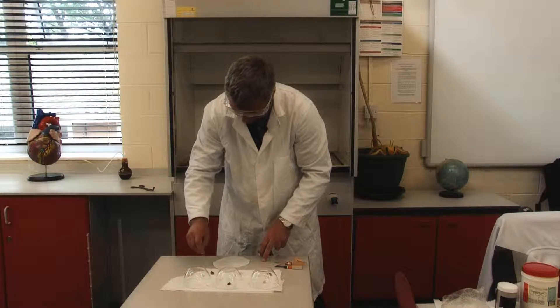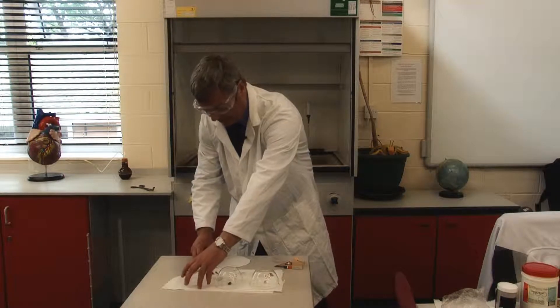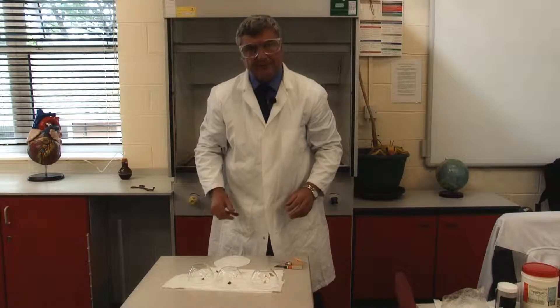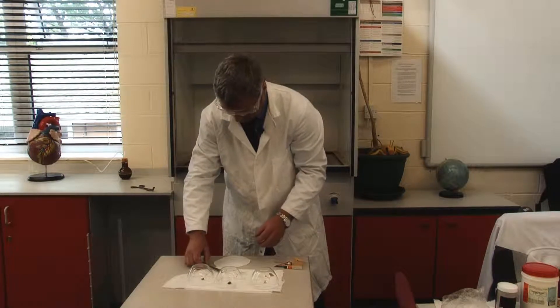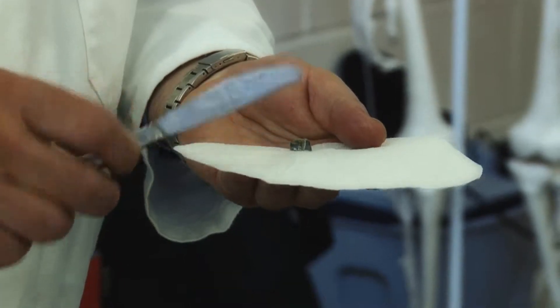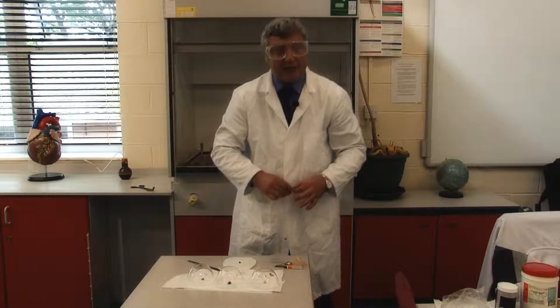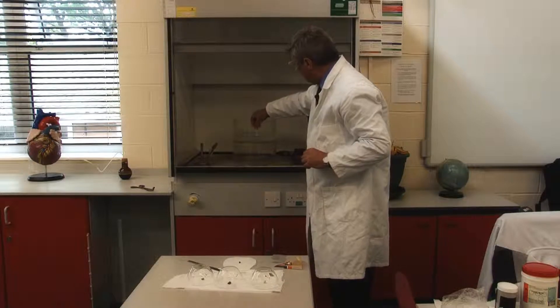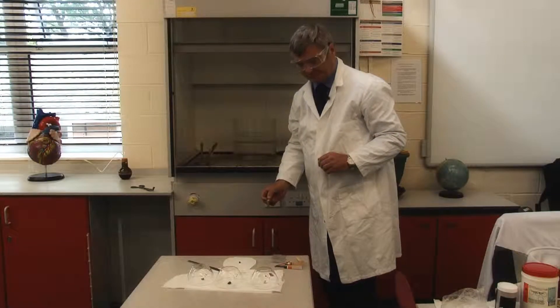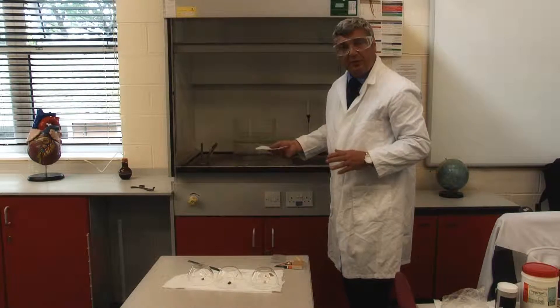As before, we can cut it with a knife — potassium is extremely soft. If you have a leftover piece it must be covered up so nothing can splash on it. Unlike sodium, we don't need to put it in with a tissue; that's just for convenience here. But as with the previous metals, it's worth demonstrating that the water in the trough is neutral at the start, and it's important that you use a fume cupboard.